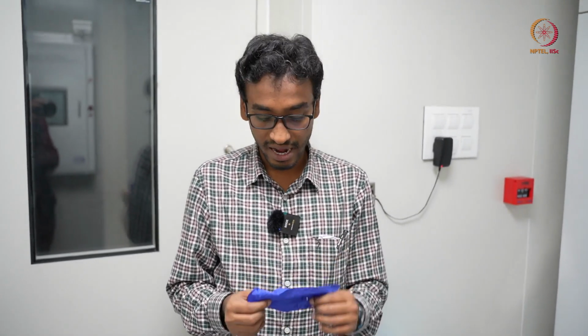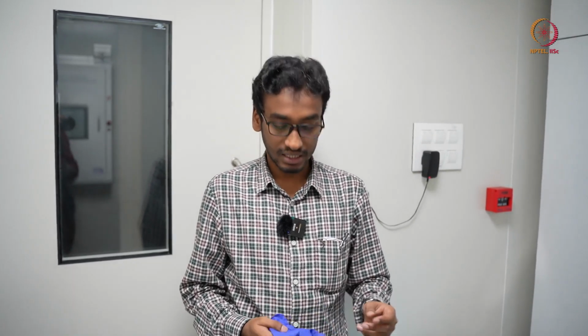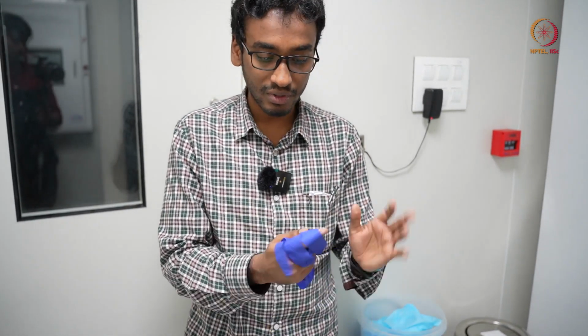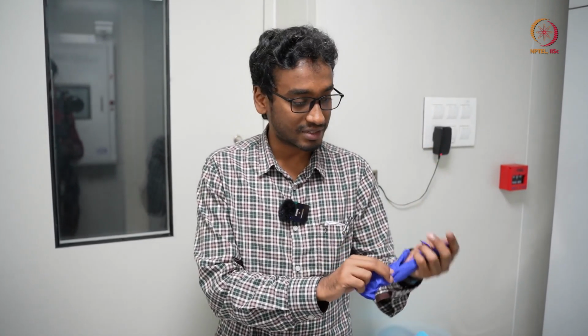So we need these powder free gloves first, and the material should be nitrile, not latex, because latex gloves have no chemical resistance. In one way, if you wear this, your sweat and all other things will not contaminate the wafer first. And when we are wearing gloves, we should not hold them like that, then their basic purpose is not served. Whatever sweat and dust particles I have, I am transferring to the fingers of these gloves.